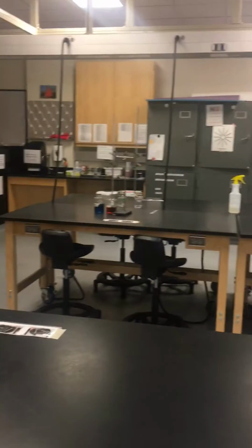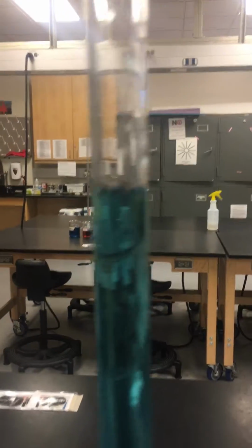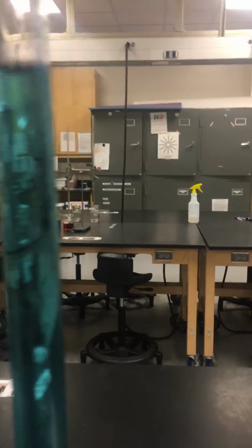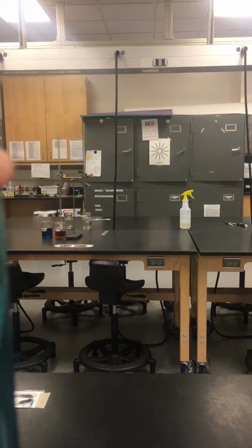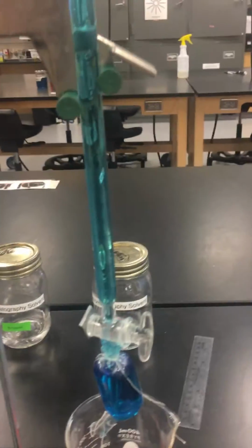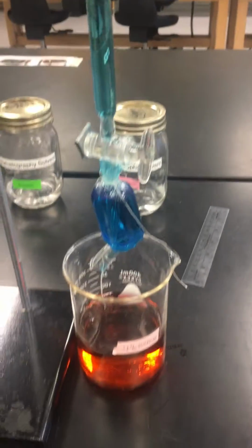Now, mark where the top line is. That is why we actually put food coloring in it, to clearly see where it is. It helps if it's on an even number, like 16 or 17 here, and not halfway in between. What you're going to do, you're going to mark the initial value.